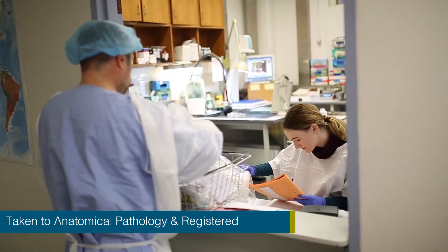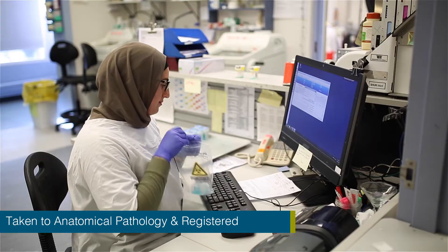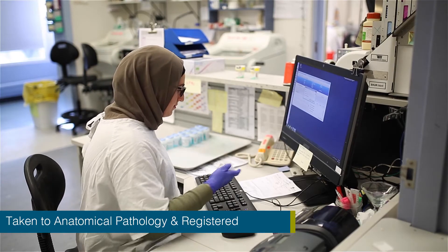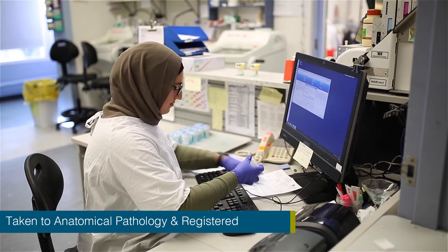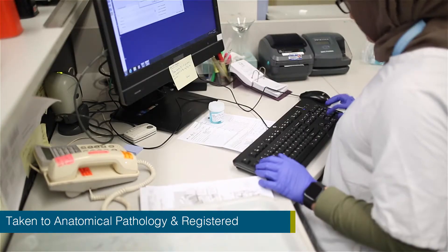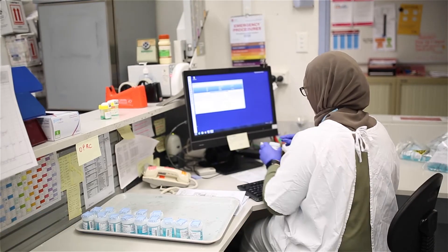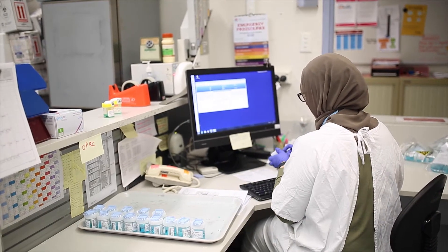At arrival to the department, the specimen is then registered and entered into the laboratory information system so that the correct patient identification is attached to the received specimen.